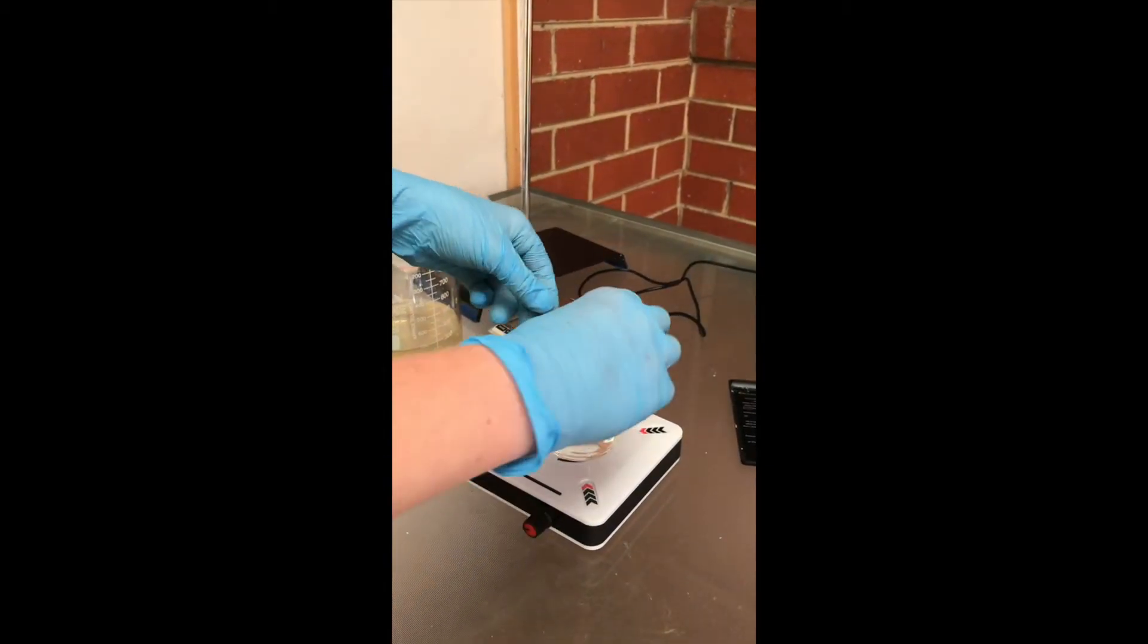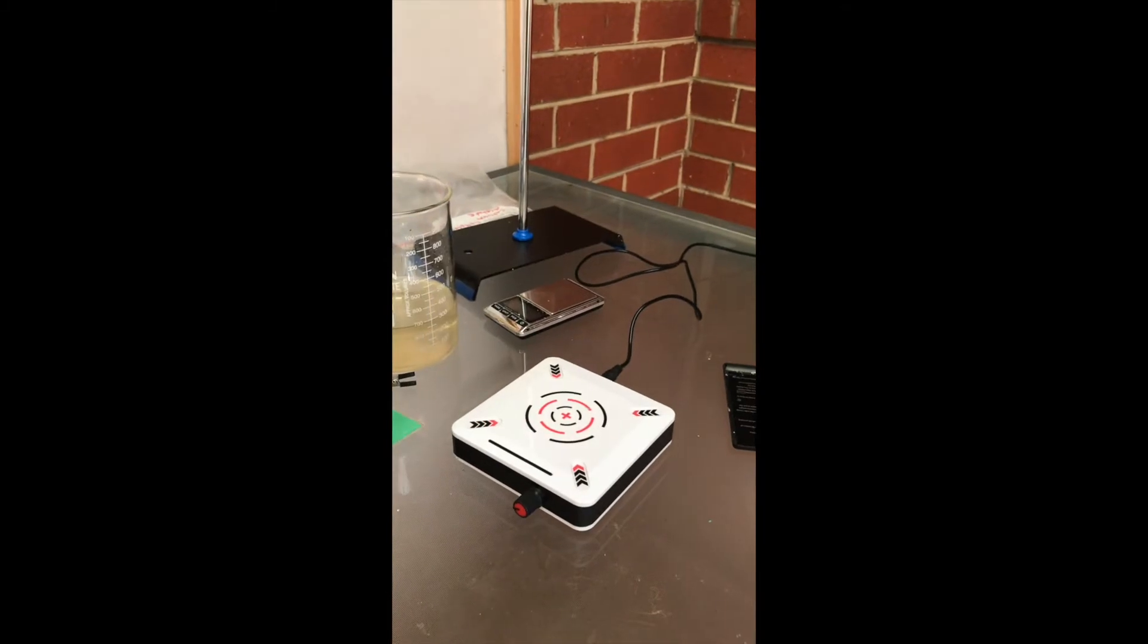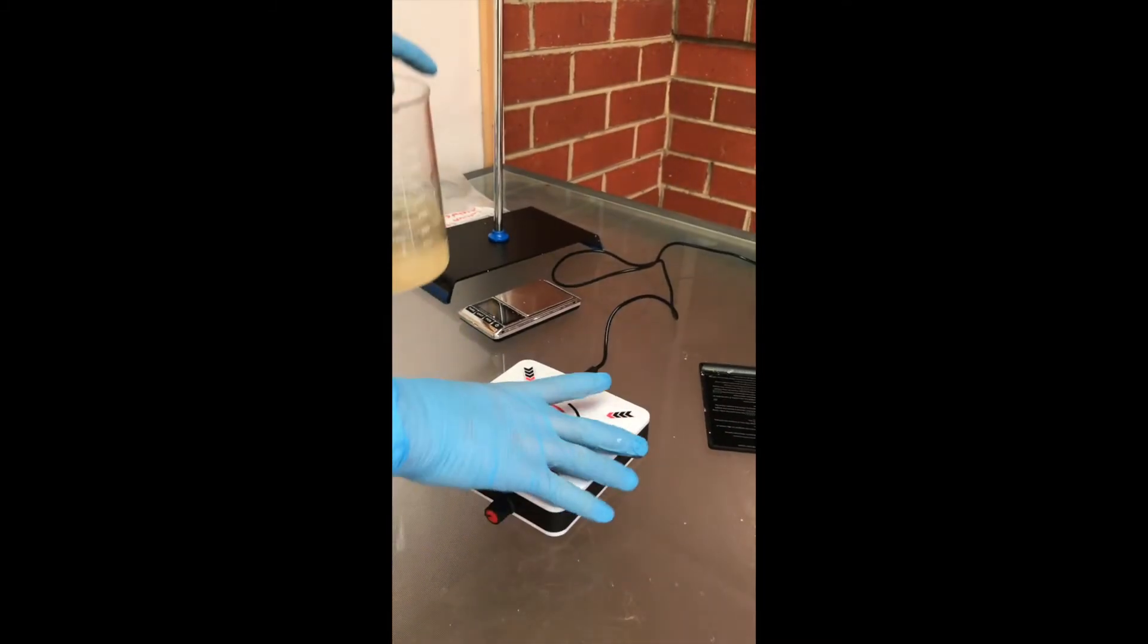Once both the reactants are dissolved, I then prepare adding them together. I am just going to swap and place the larger beaker onto the stirrer.